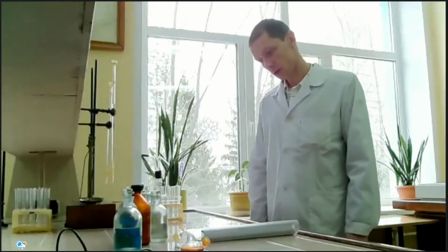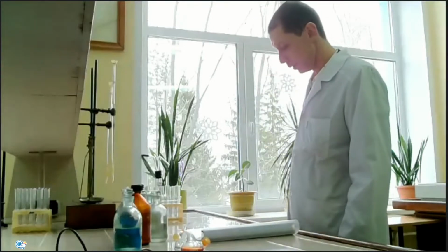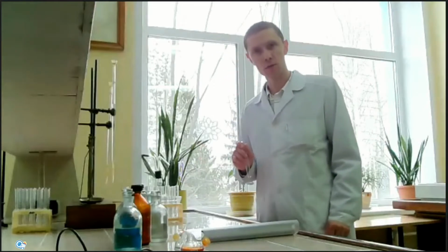Hello everyone. Today we will study acid-base and amphoteric equilibria and heterogeneous equilibria. Let's start from experiment A.